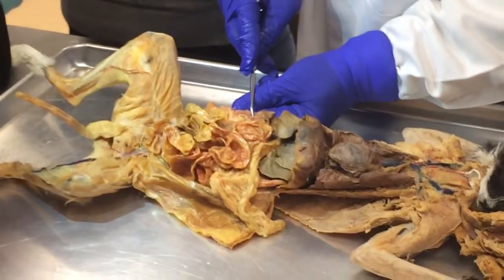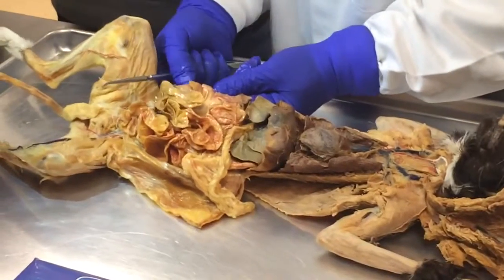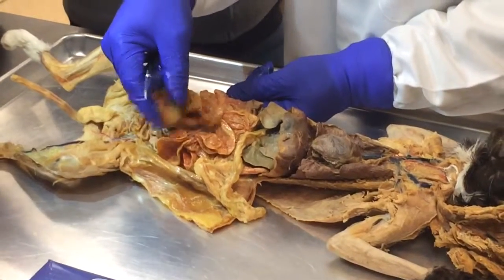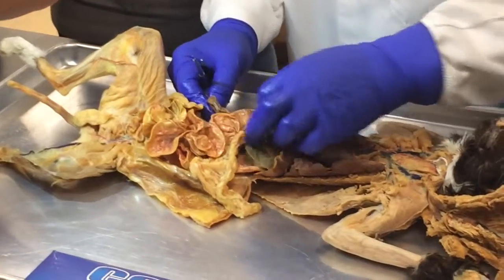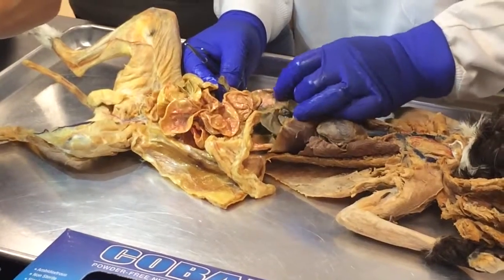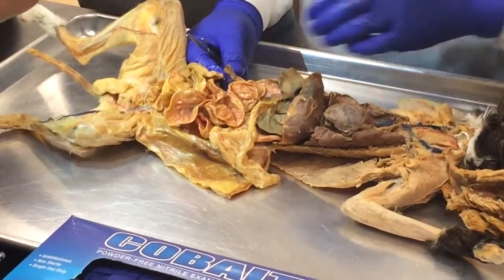You see? So this would be the ascending colon. So if I put a sticker here, you say ascending colon. If I put a sticker very close to the colon, like right there, then you would say ileum. If I put a sticker there, you'd say jejunum. And the rest of it, anywhere in the middle, you know, because again, and then if I put a sticker close to the stomach, right by the pancreas, because there's nowhere else I can put it except there, it's duodenum. Oh, okay. So that shouldn't be too bad.